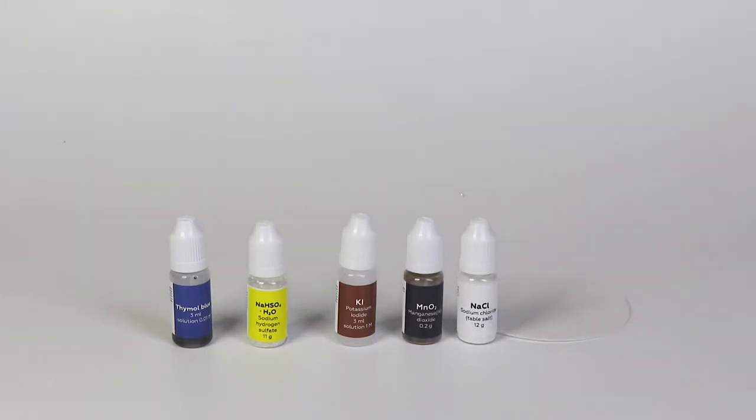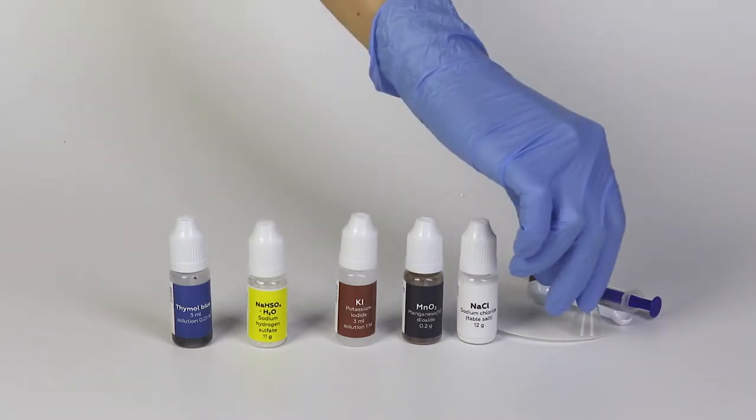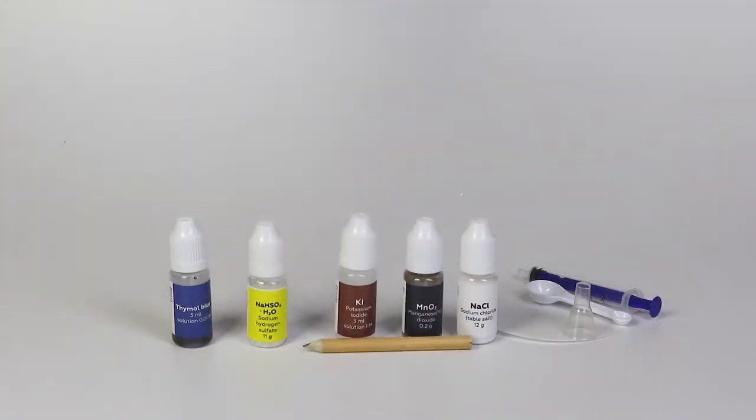You will also need filter paper, a 3 milliliter syringe without a needle, a measuring spoon, a plastic funnel, a pencil and three candles.